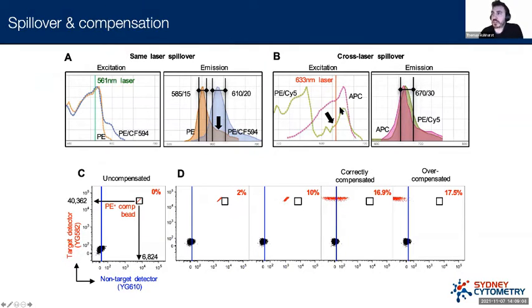We can have a similar situation where we're getting a laser that excites two fluorophores that are not the same. This is not exciting PE-Cy5 optimally. It's at about 30% of what would be optimal. And it's exciting APC really quite strongly. But the emission properties of both of these molecules are very much the same. So even though we're not getting optimal excitation of PE-Cy5, it's still going to show up in the same detector that we would detect APC, even though we kind of think of them as belonging to different lasers. We're going to excite normally the PE-Cy5 using the yellow-green laser and APC using red, but the red is going to excite the PE-Cy5 whether we like it or not. And so we're going to get this cross-laser spillover in this case.